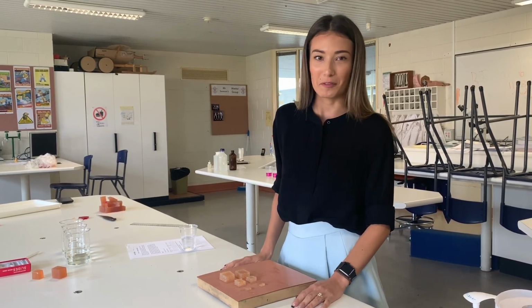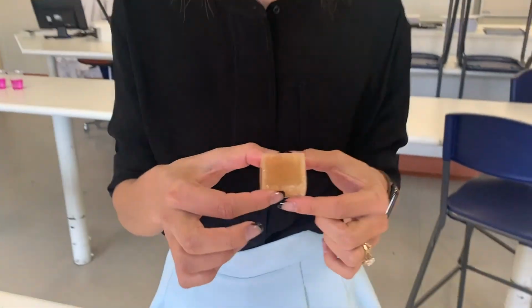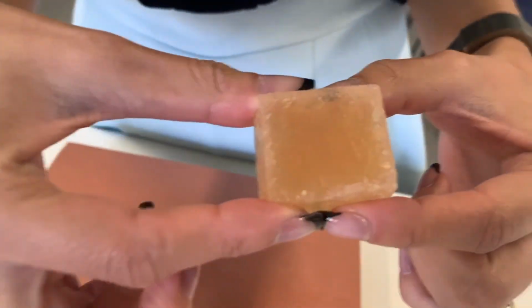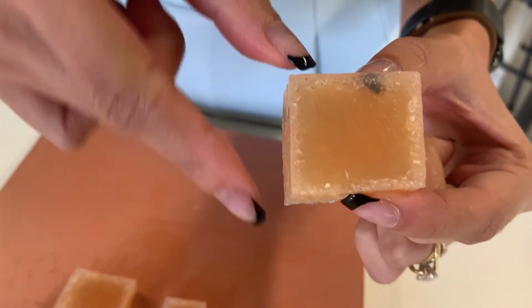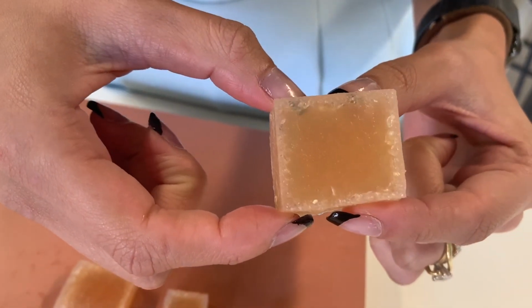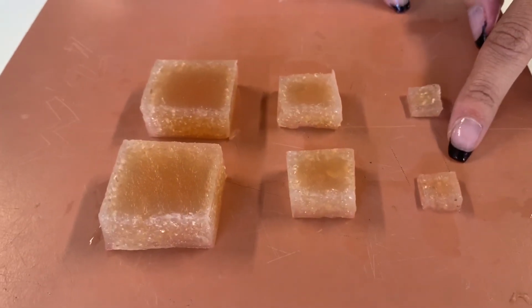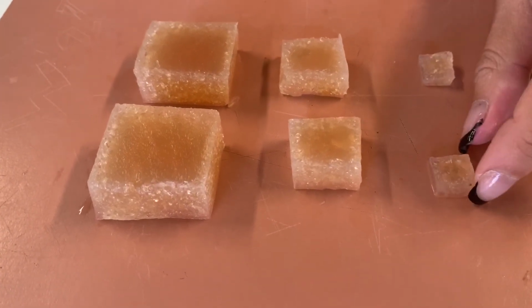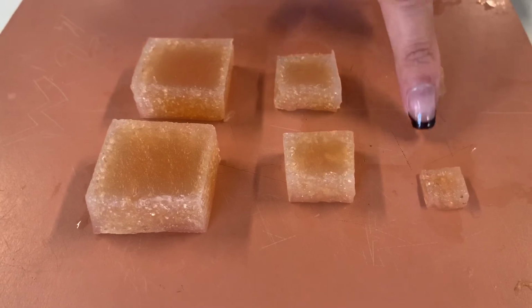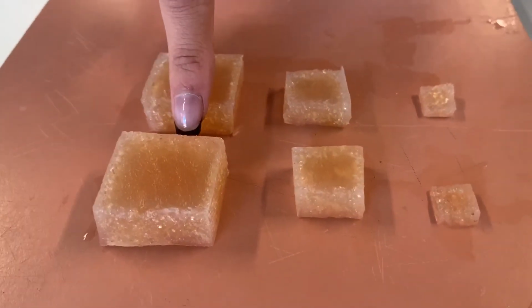Looking at the cubes that we have now removed from the vinegar, we can see that on the borders and edges of each gel, so we've just taken a cross section of them, there is some discoloration and a change in texture and consistency of the gel in that border. So in comparing the gel sizes, we can see that our smaller cell cube is far more efficient. We have that change in consistency and colour being far greater seen in comparison to our larger agar gel cell.